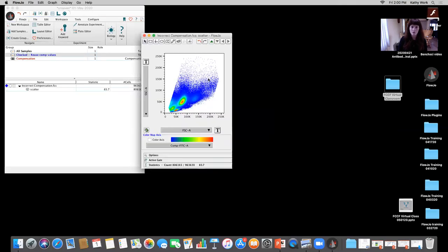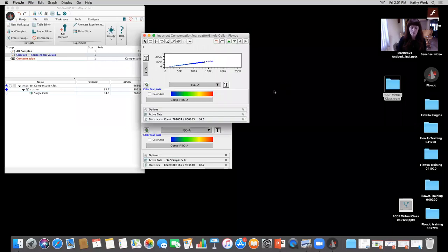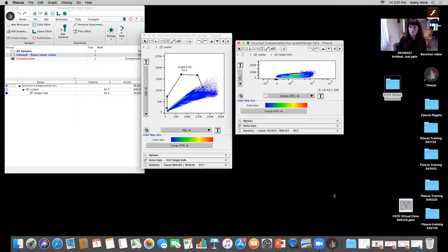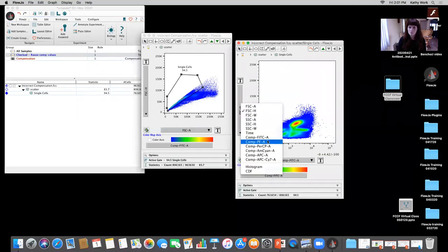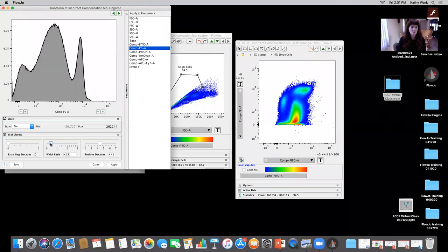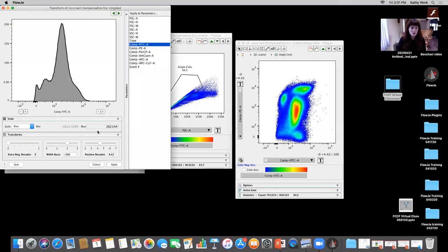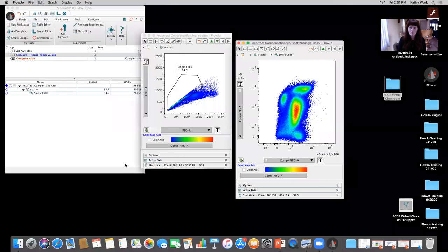Then from there, we're going to look at our singlet gate. And remember, we can use forward scatter, side scatter, we can use multiple parameters. Single cells. Then they wanted their FITC positive and PE negative. Okay, using this transform button and adjusting the width basis is going to be helpful. So I customize the axis here, bring this width basis down so we can get a better visualization. Okay, try and pull that out a little bit better.